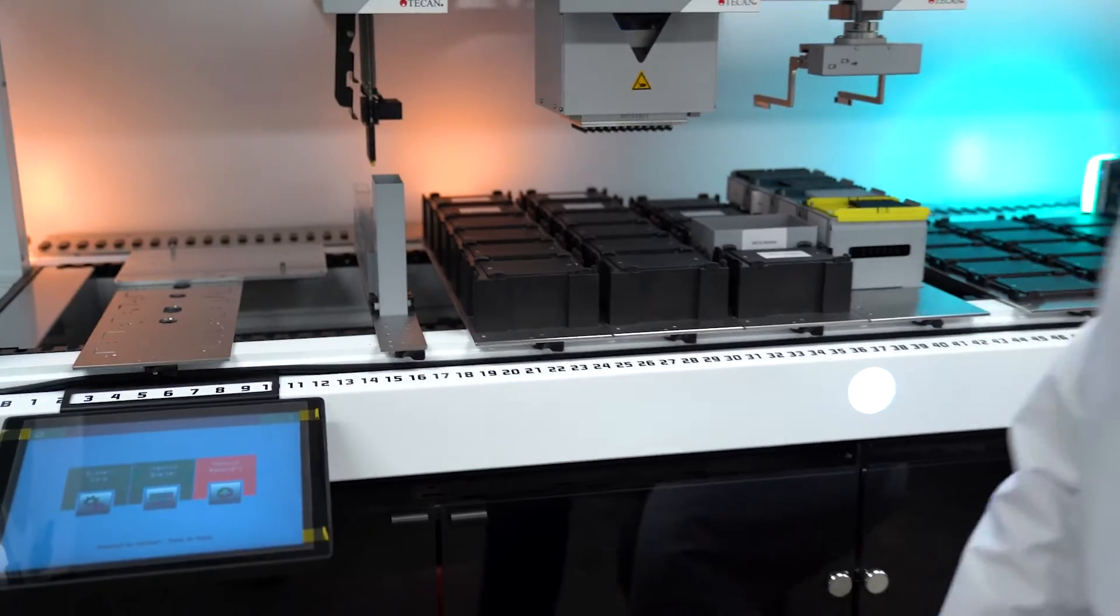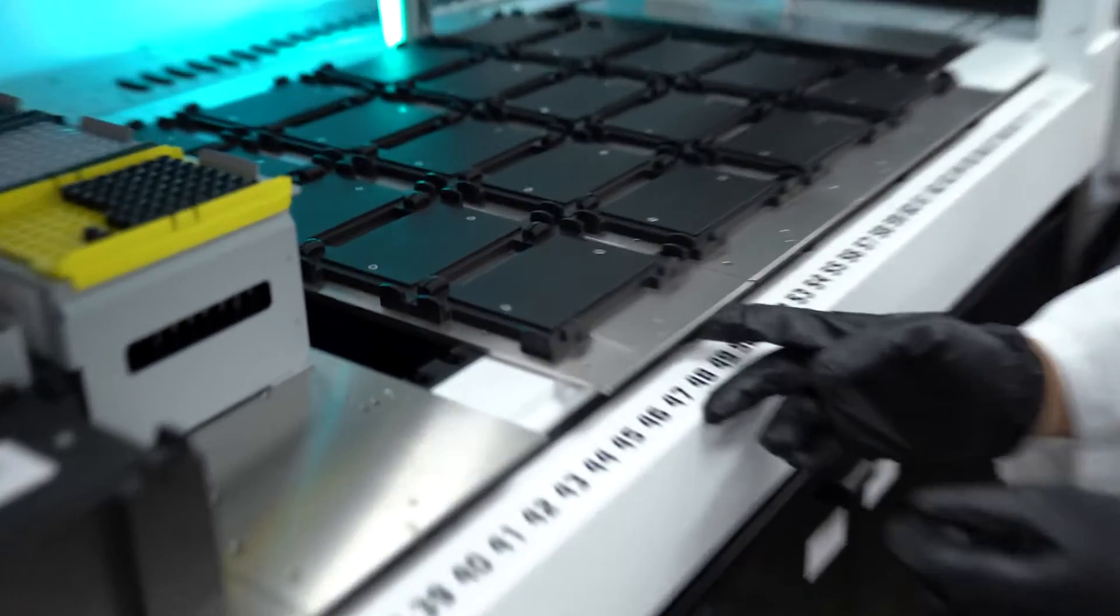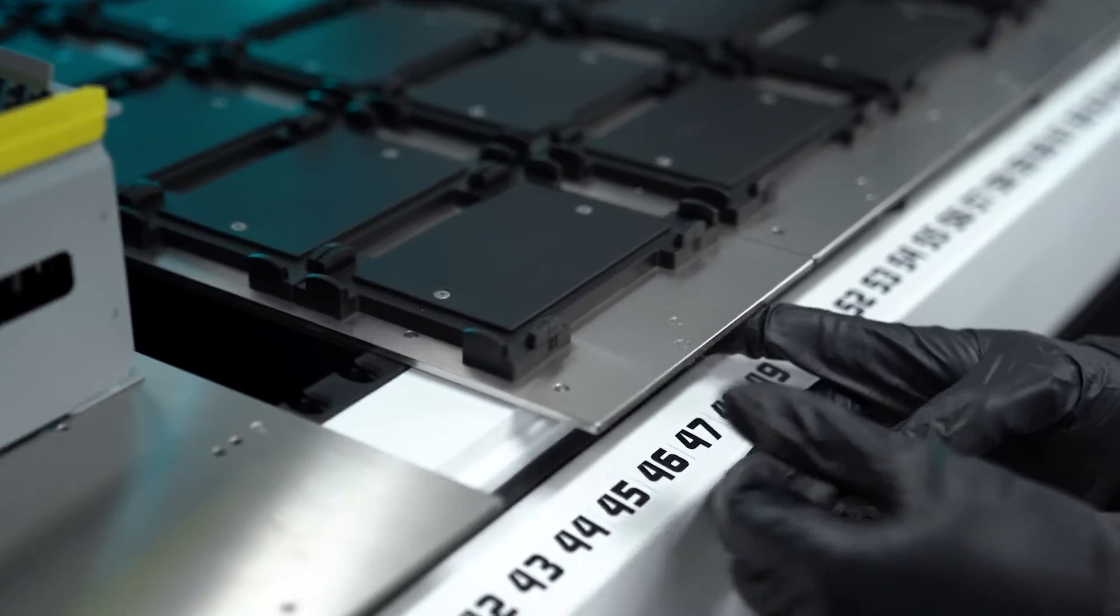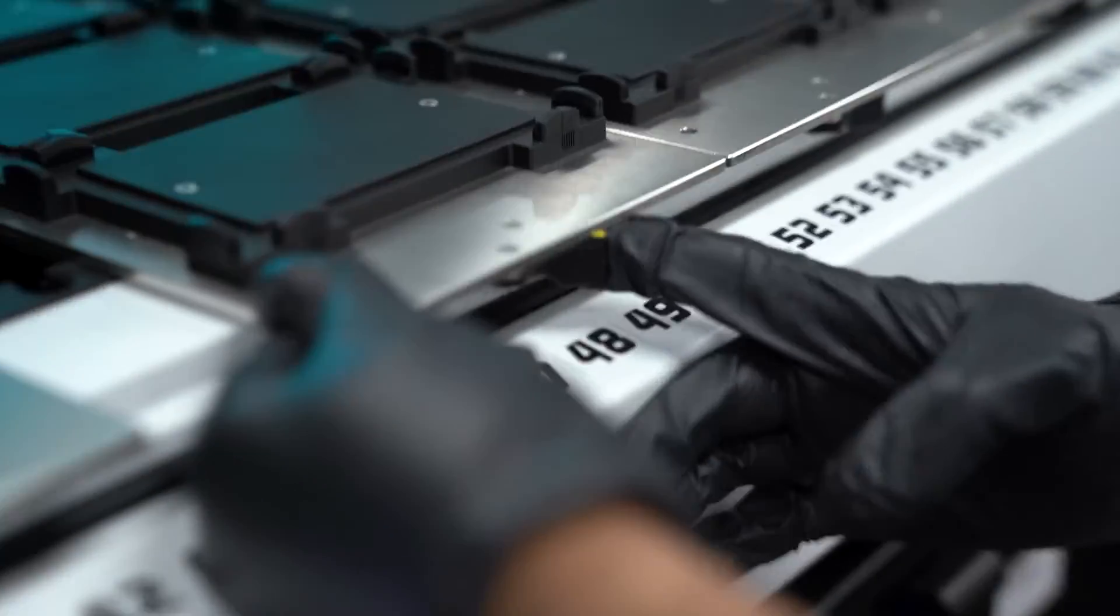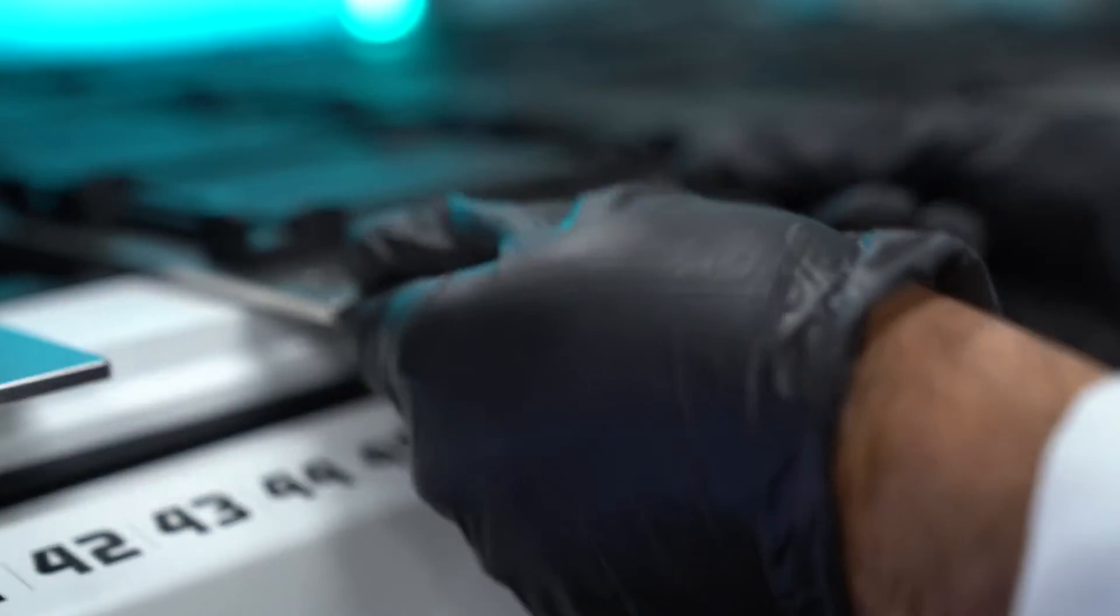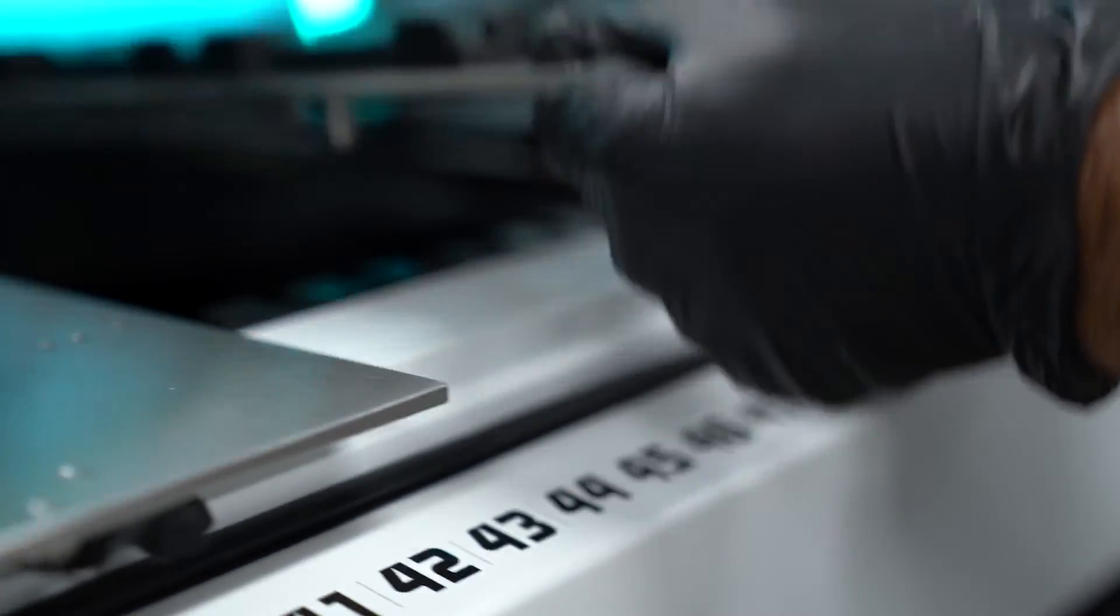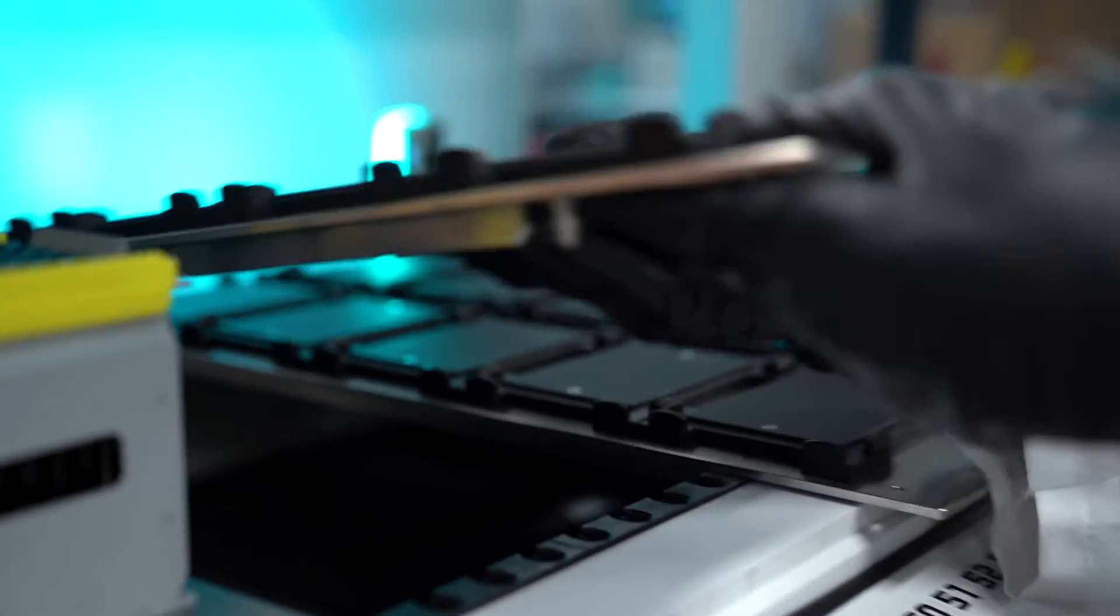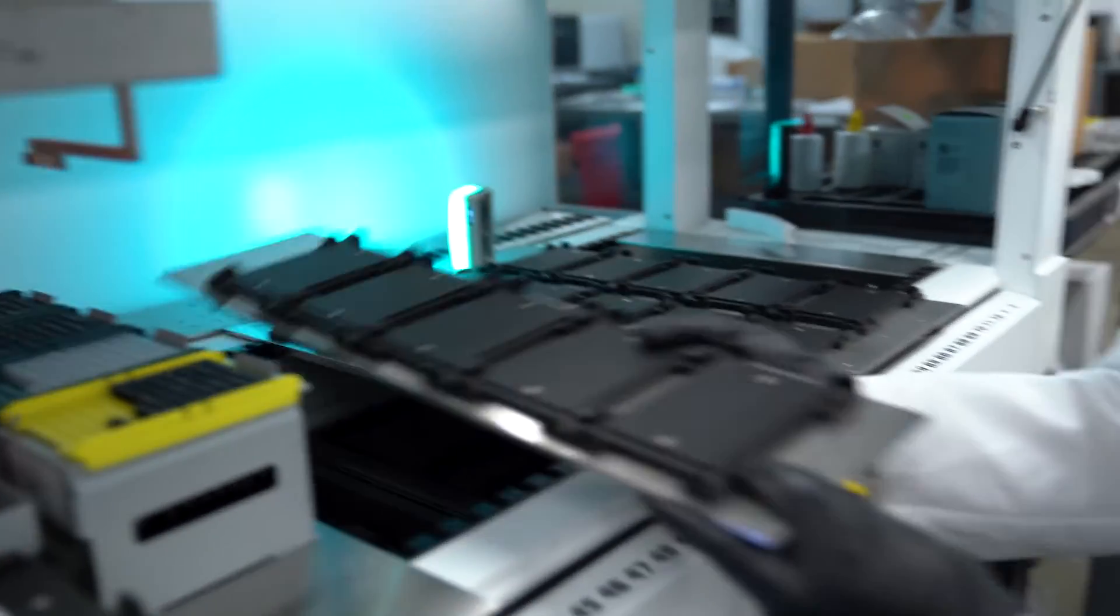If you want to know what a carrier is, these are the carriers and this is how you lift these guys in. You click this tab, push it in, and this is how you take these guys out. So this is the carrier.